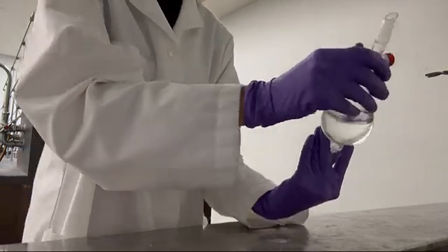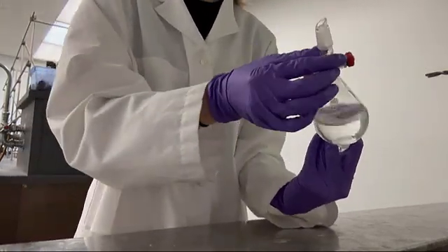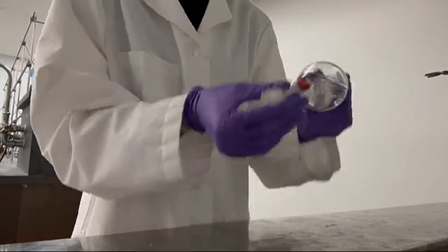As a reminder, make sure you are venting the end of the funnel towards the fume hood and not out in the open.